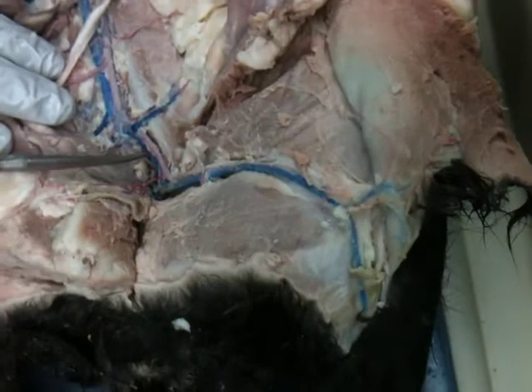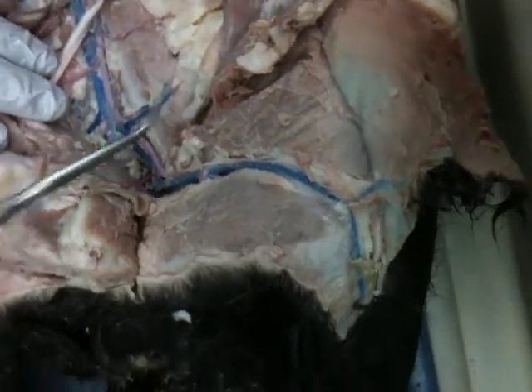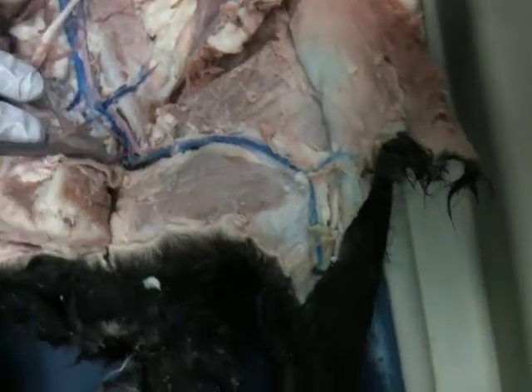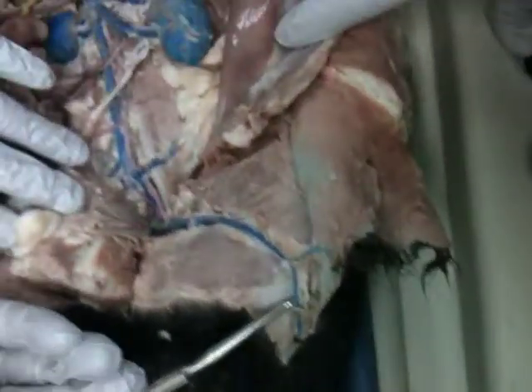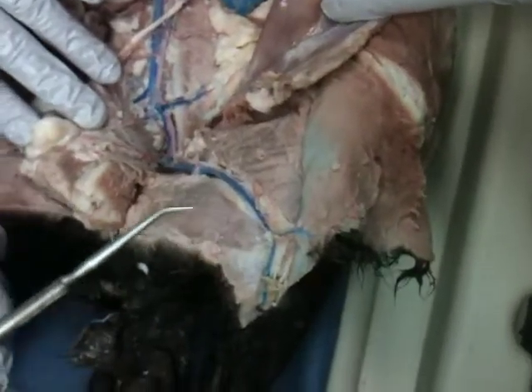The external iliac vein will continue on. Once it crosses this abdominal wall here, it's the femoral vein with its artery there. It also sends branches out to our deep femoral vein and artery that goes down it. So the iliac actually combines with the femoral, and it's the femoral that branches out.